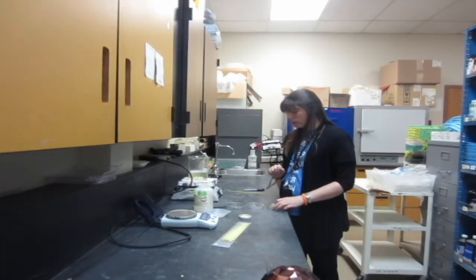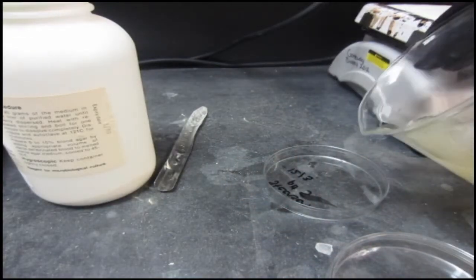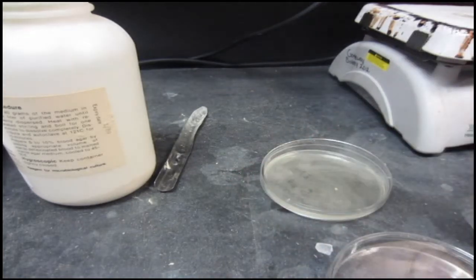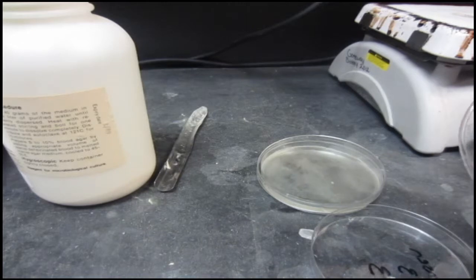When you are ready to pour your agar, all you want to do is quickly lift the lid. Wearing a glove for protection, you want to pour in your agar, then close the lid again and go to the next one. Just do that all the way down.